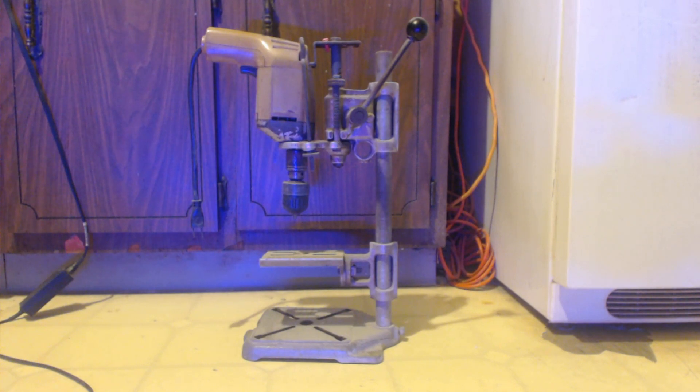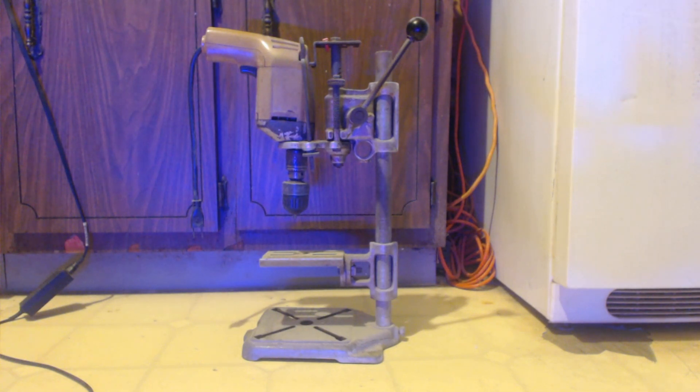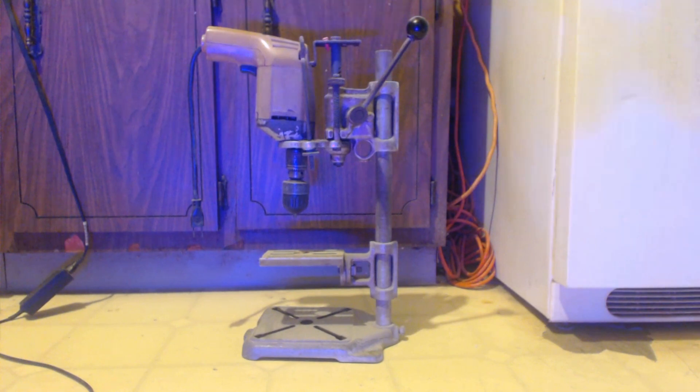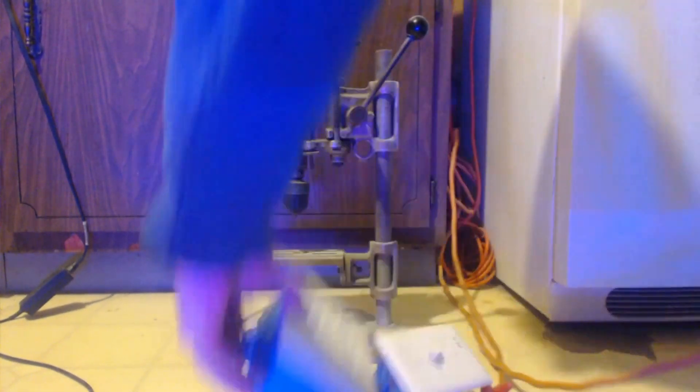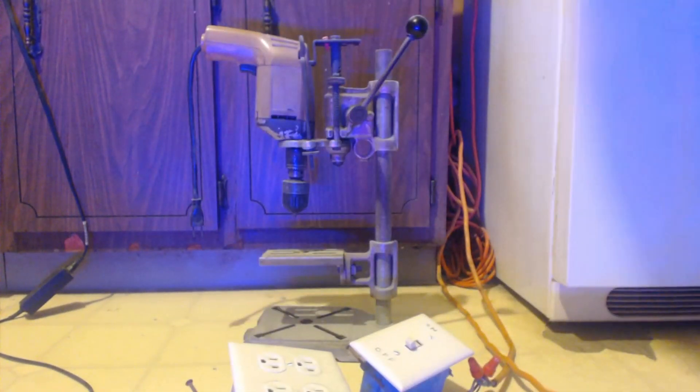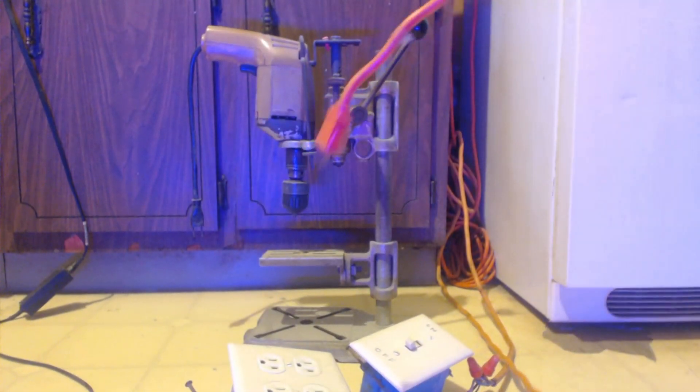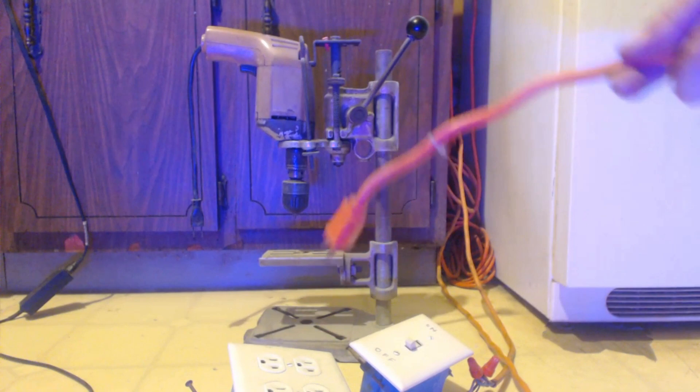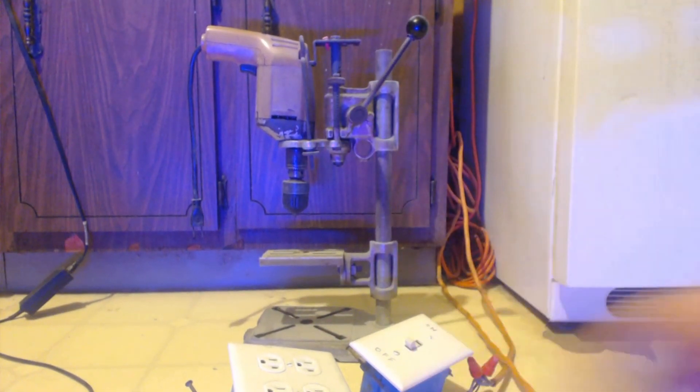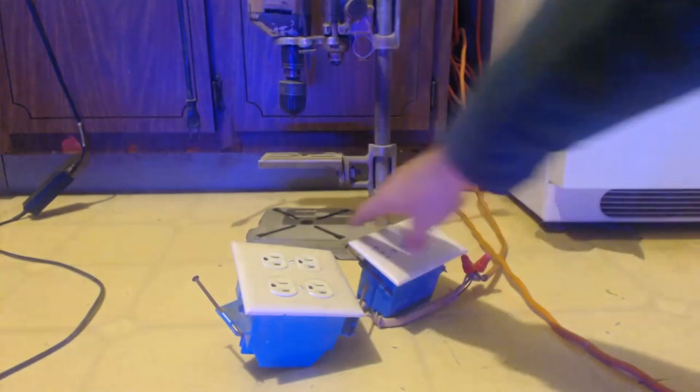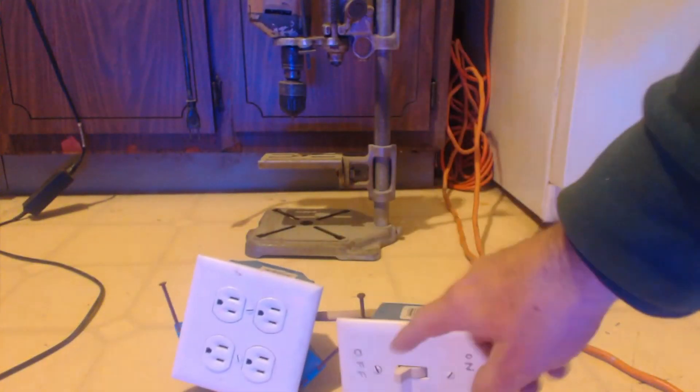And then I could just plug that into, you see how I have that, it's just an extension cord, right? And I wired it up, you know, I cut the extension cord off, wired it up so that it goes through the switch and then these plugs.